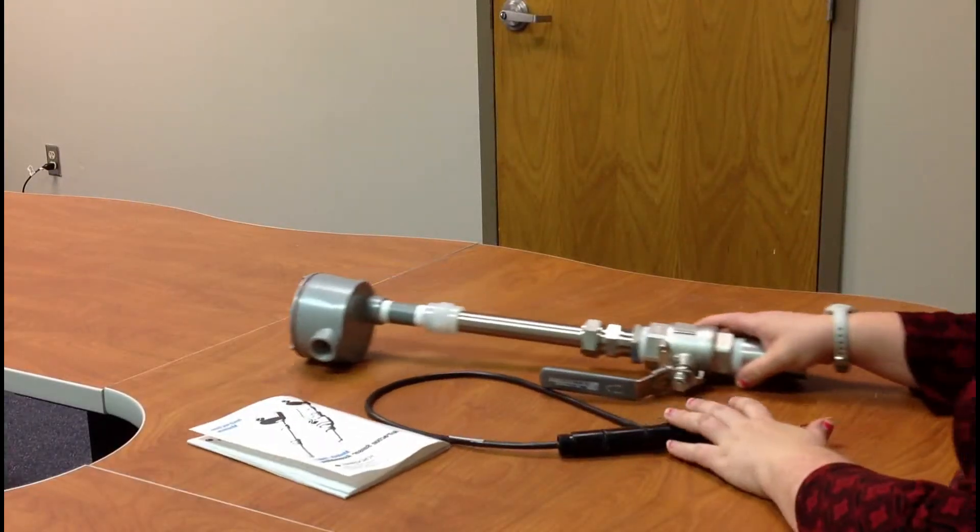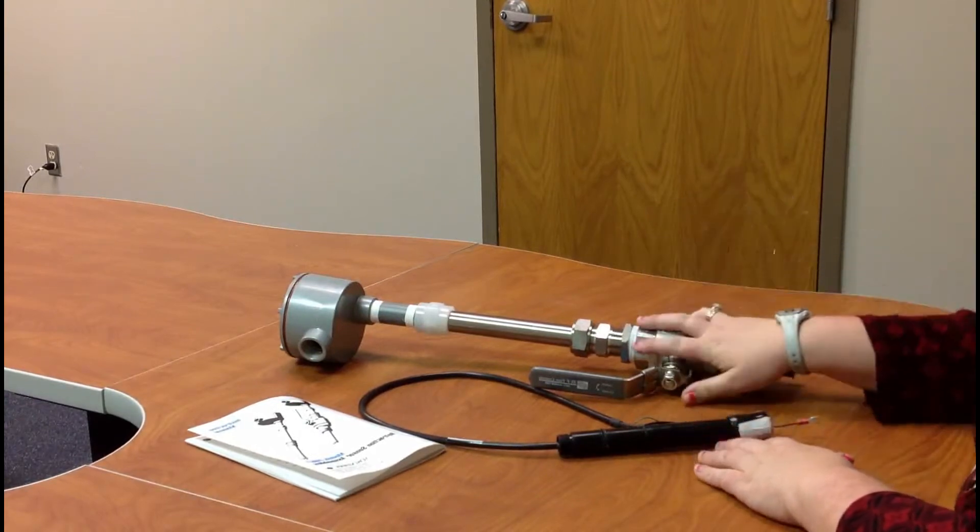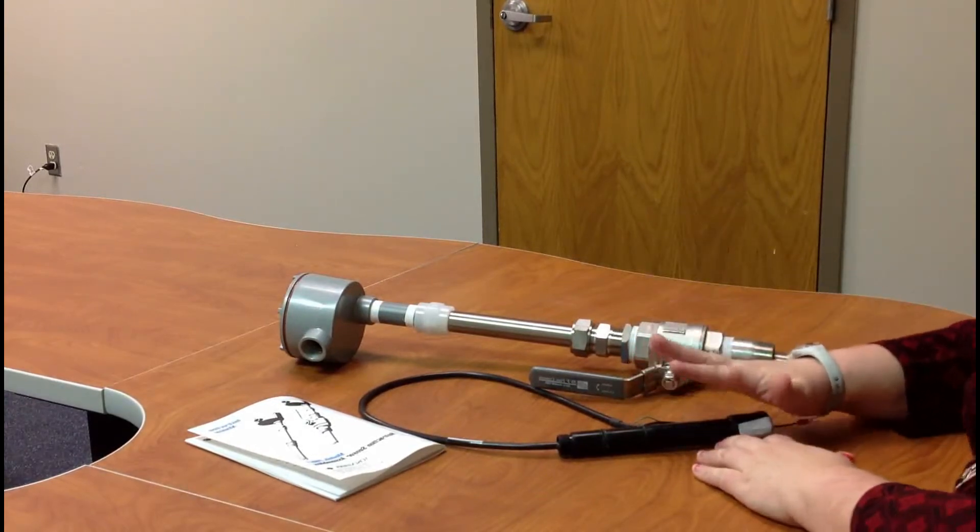Okay, so very quickly, we are going to go over the basic installation steps for our PH-87 retractable and our PH-97 sensor.